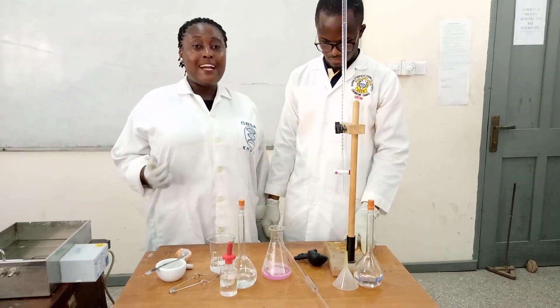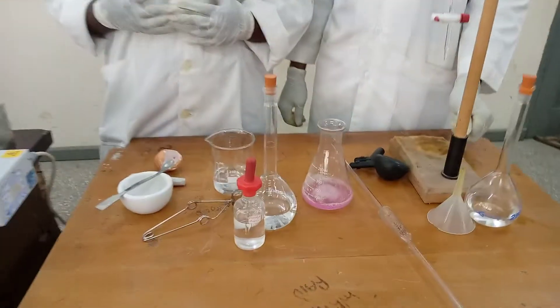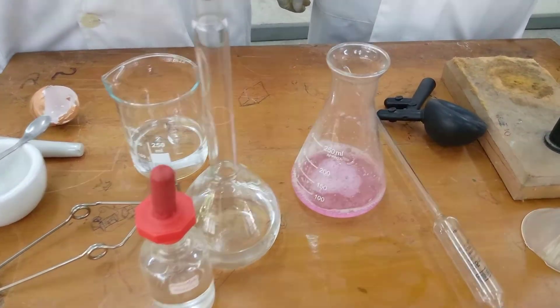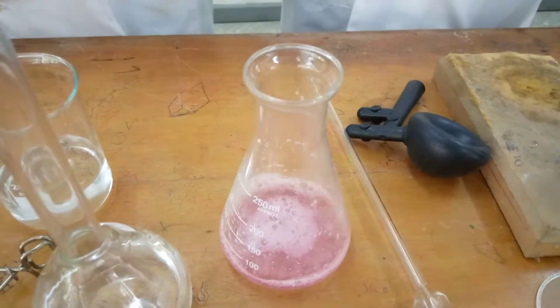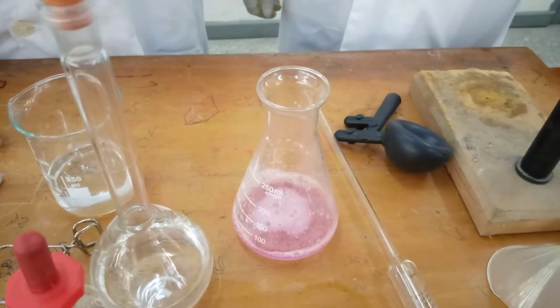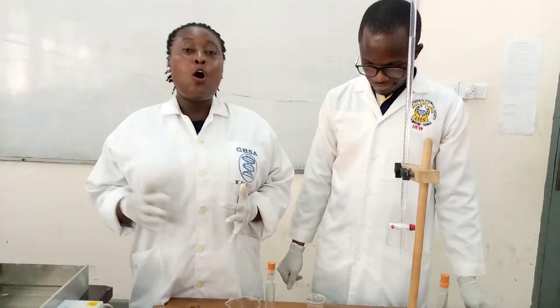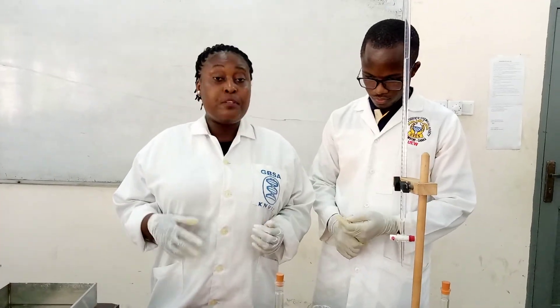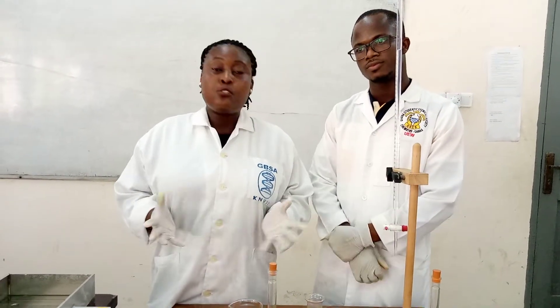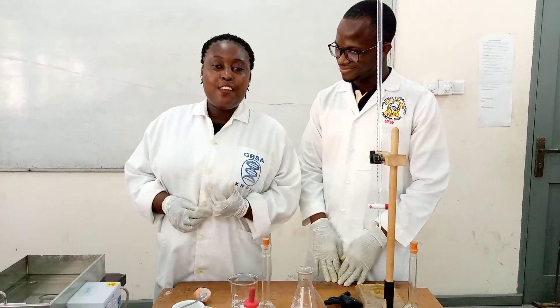This is all about back titration. In back titration, you react an analyte with excess reagent — here, our analyte is the eggshell and the reagent is the HCl. Because we don't know the exact amount of calcium carbonate content in the shell, we have to react it with excess HCl. Using excess HCl ensures that all the calcium carbonate in the shell will be reacted. That is why we react it with excess HCl.